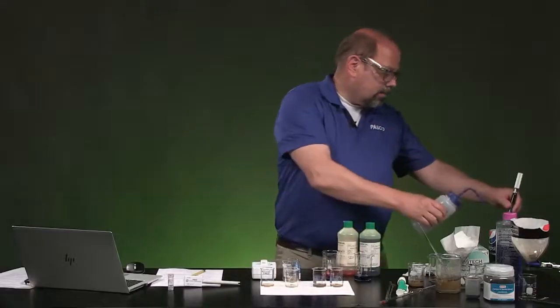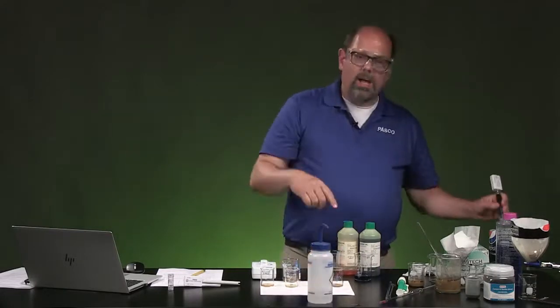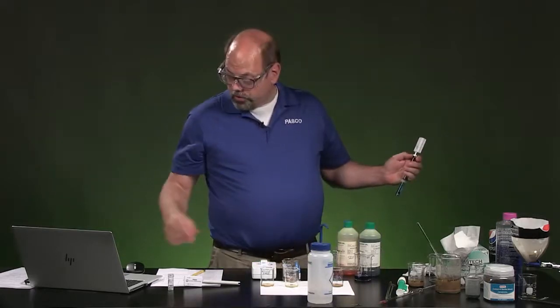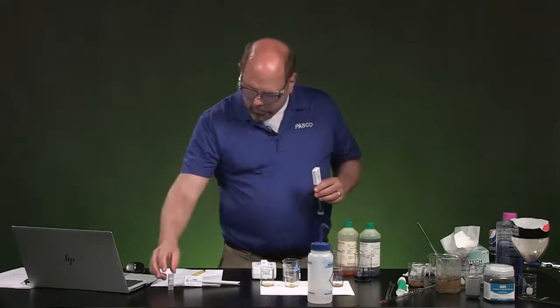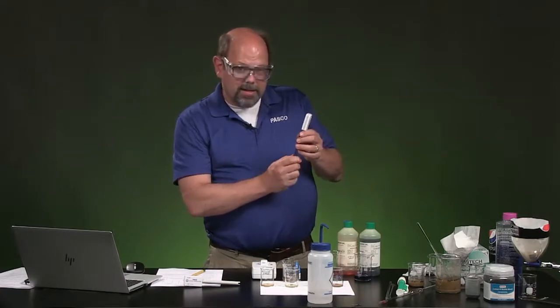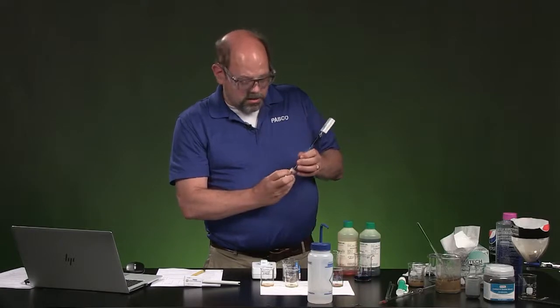So that's calibrating the pH sensor and measuring. Obviously, you want to do that before you measure, especially if you're the first class or something, so that you get this to be measuring what's supposed to be coming out. Again, I had just performed this calibration right before filming this, so even though I did it second, my values are still ones I would trust.